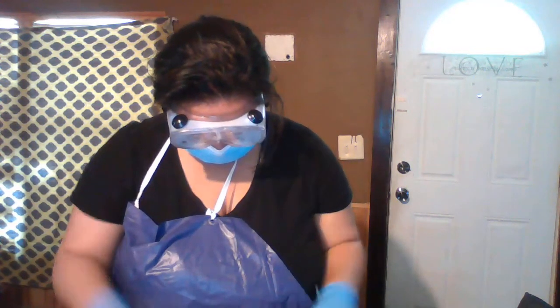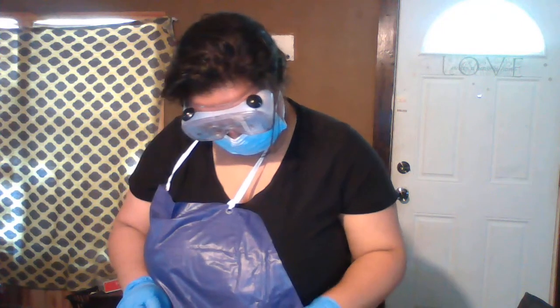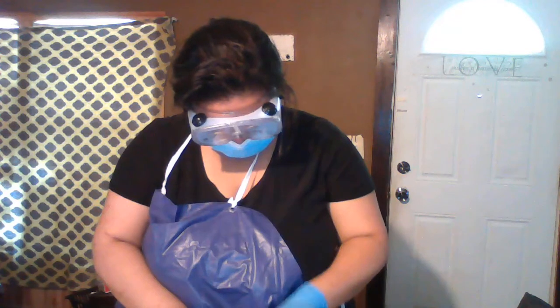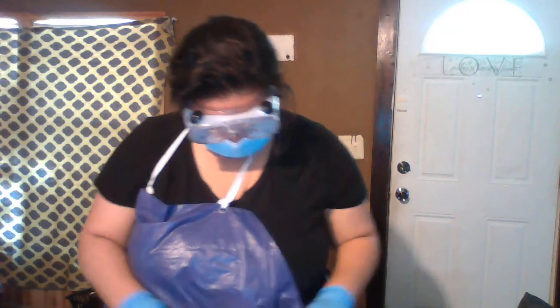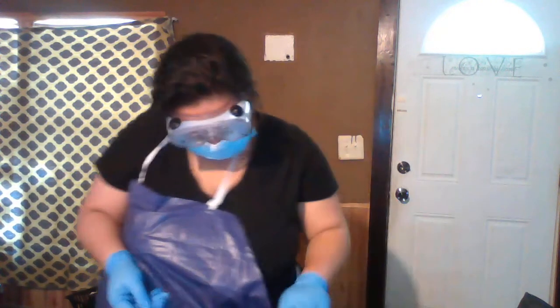There's my scalpel. I cut through the brainstem.